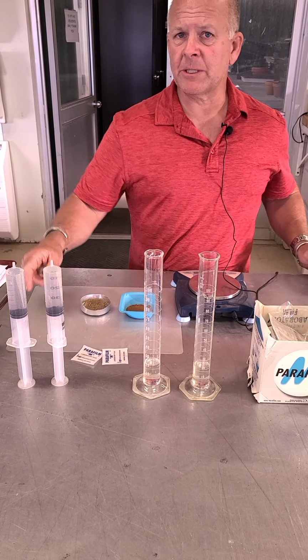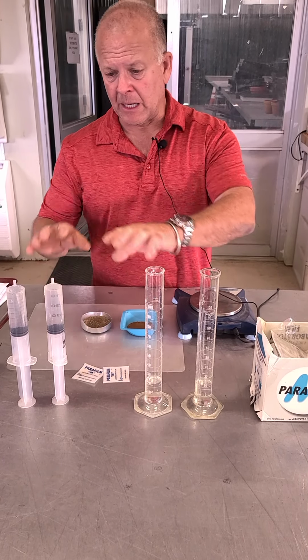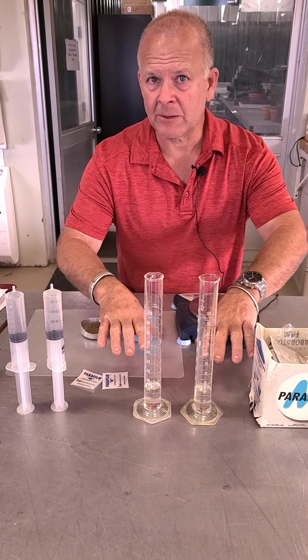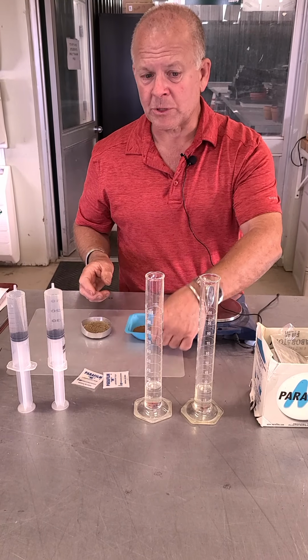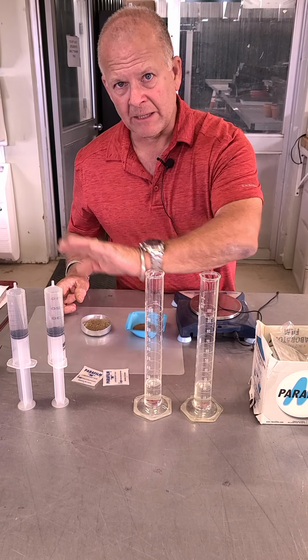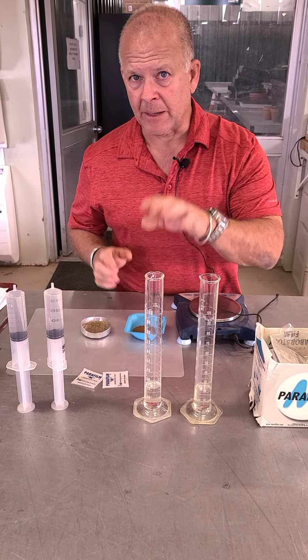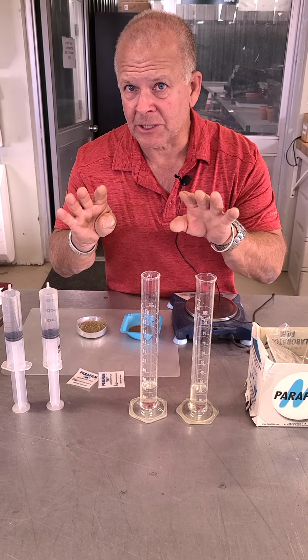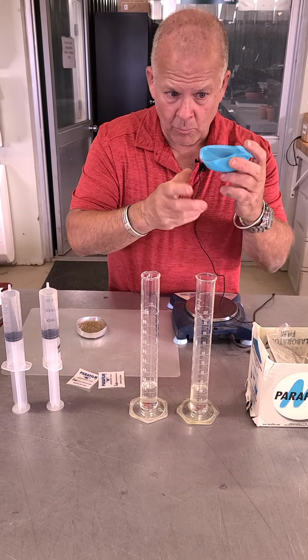And then I've got two syringes here with 40 mils of water in them. You're going to see why I'm going to need those in a minute, and they're exactly 40. So I've got exactly 20 mils of water, exactly 20 grams of soil, which I'm going to pour in here, and I've got exactly 40 mils of water that I'm going to use to rinse the soil off the sides of this. So I'm going to know exactly how much water is actually going in here, right? And I know exactly how much soil. So what's going to happen here?